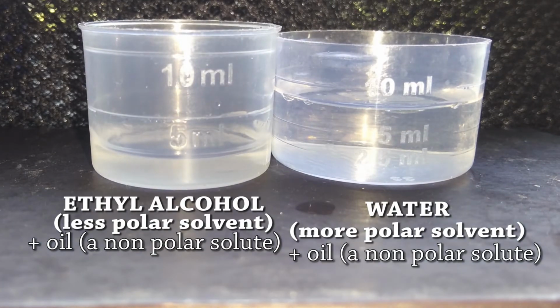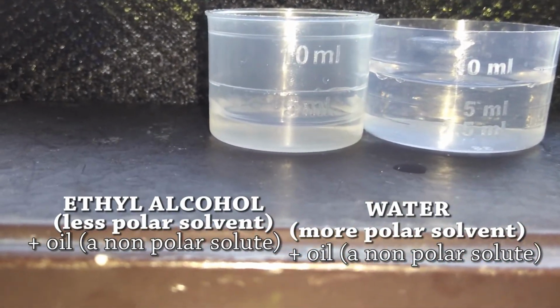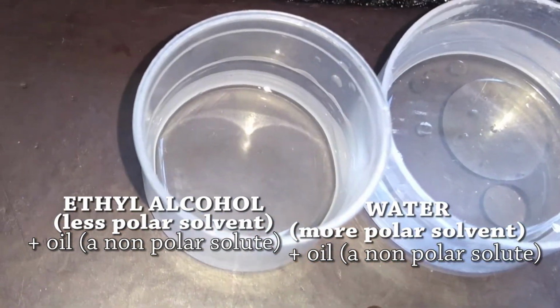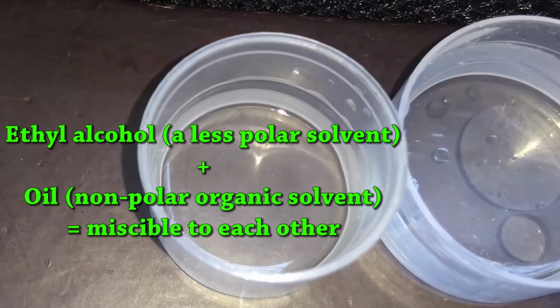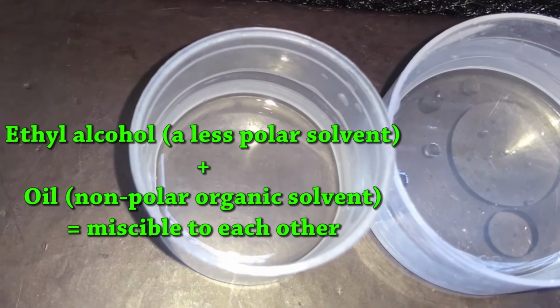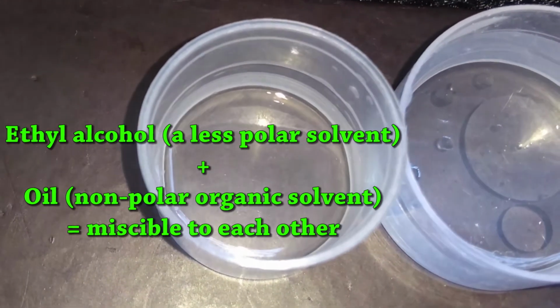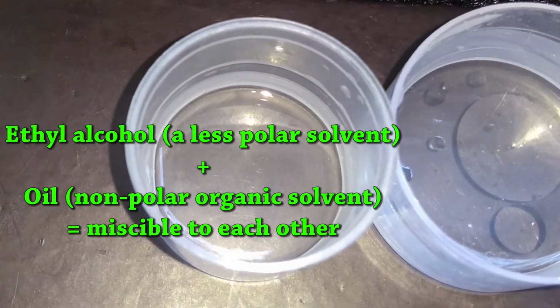What we are clearly seeing is that coconut oil, which is a non-polar organic substance, is soluble in ethyl alcohol, and we know that ethyl alcohol is a less polar solvent than water.